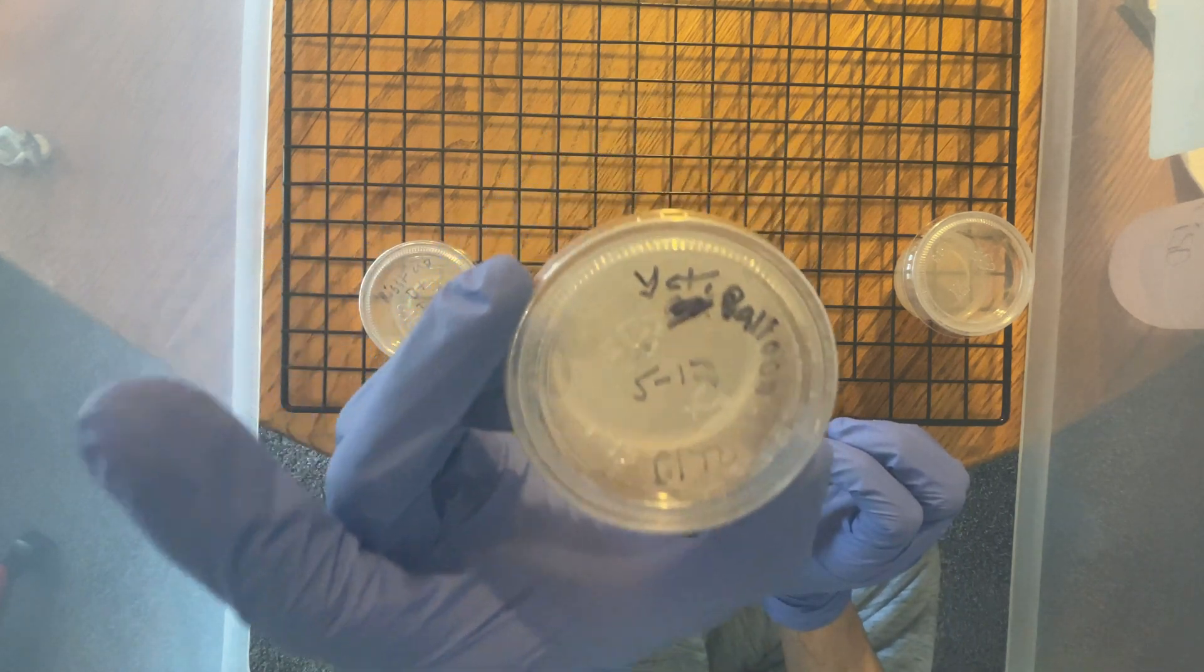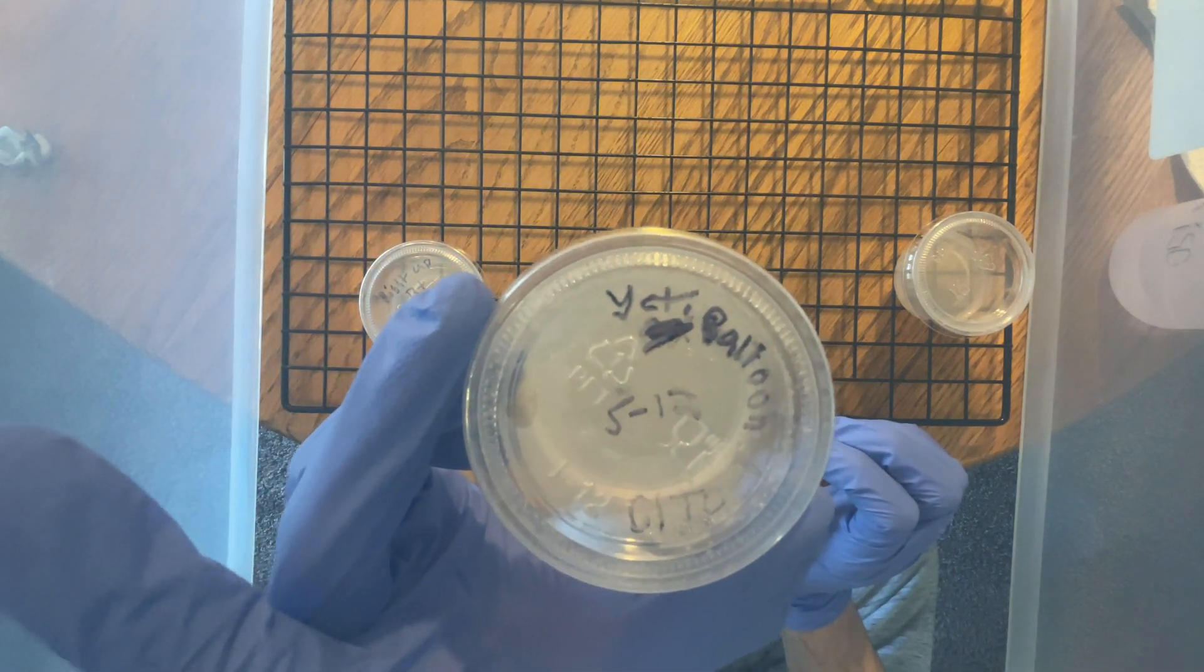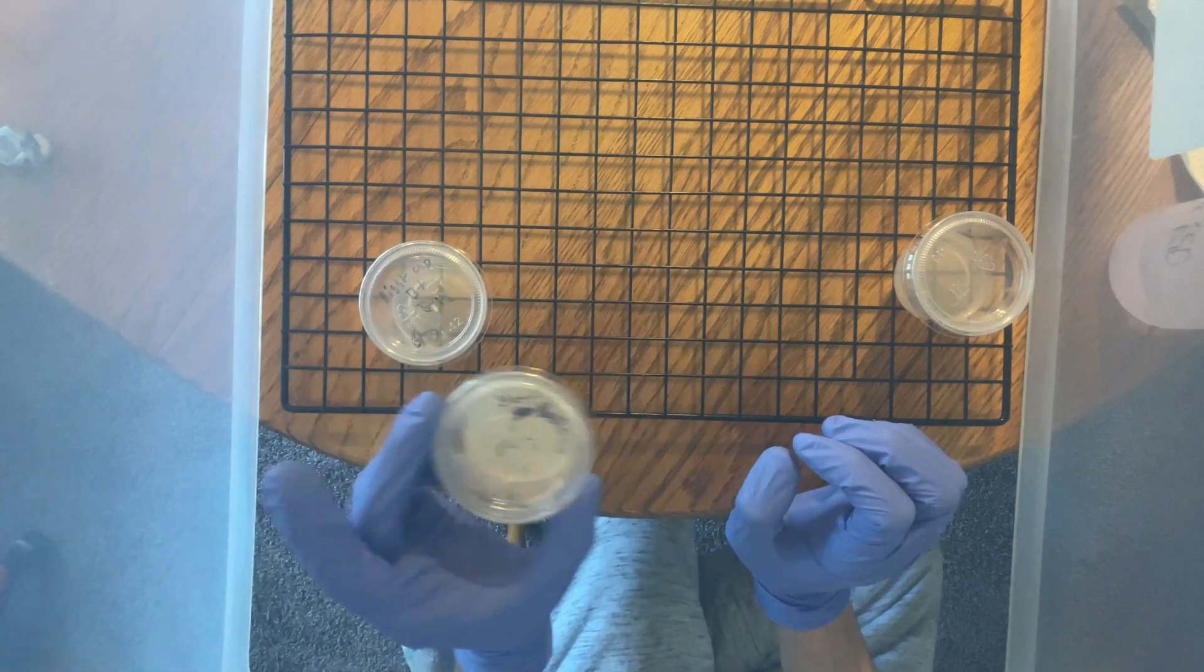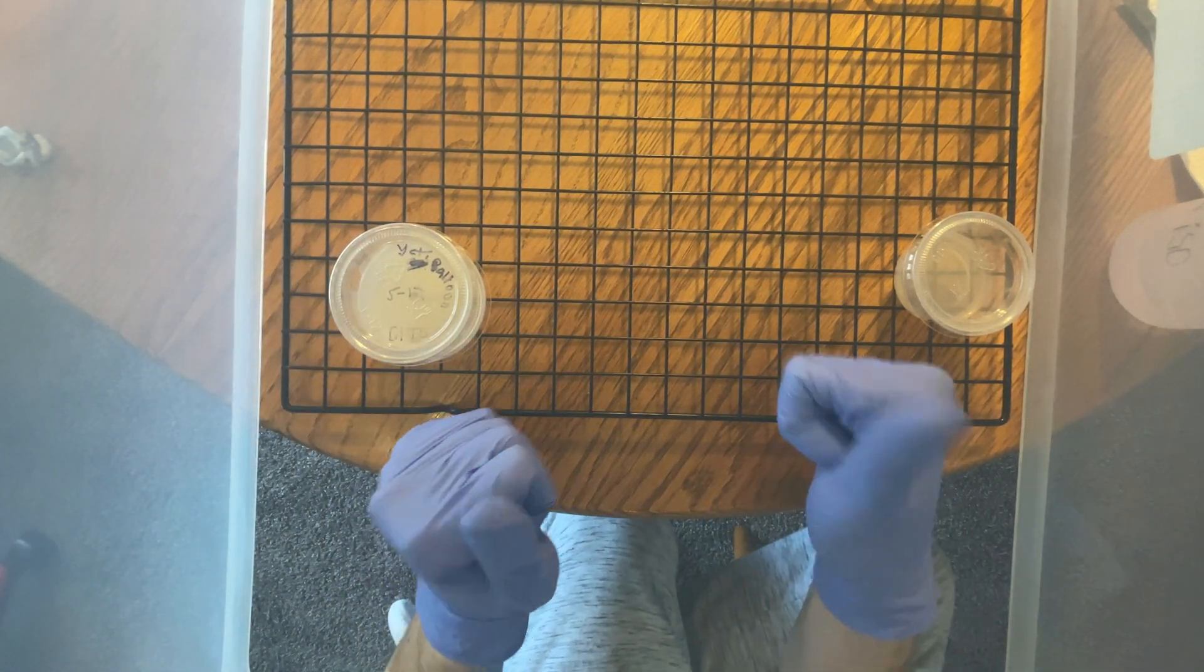And when you're all done, make sure to label your plates. This ensures that you have no mix-ups as honestly, I would just rework it if I got too mixed up.